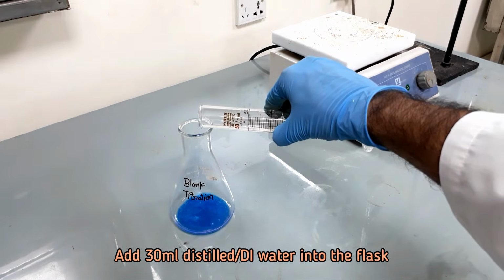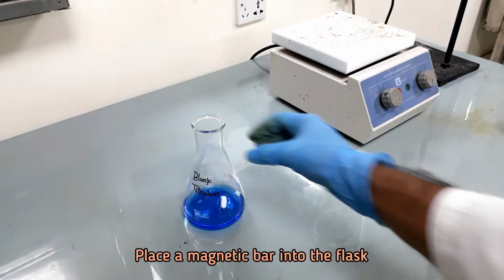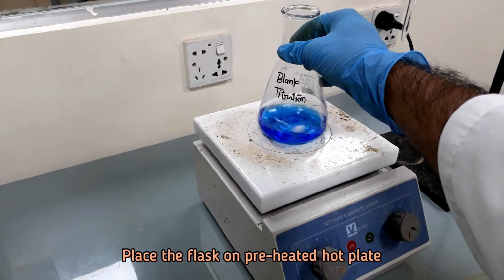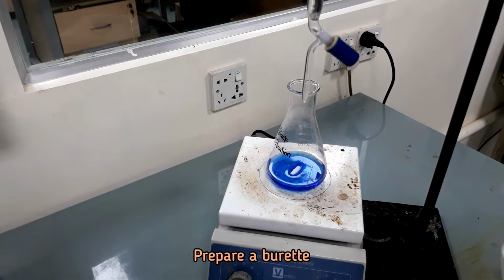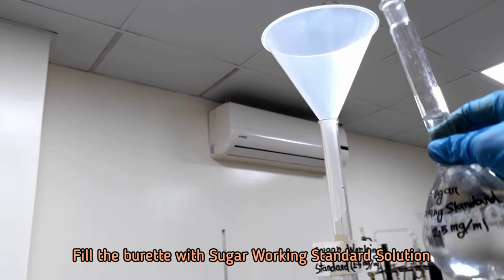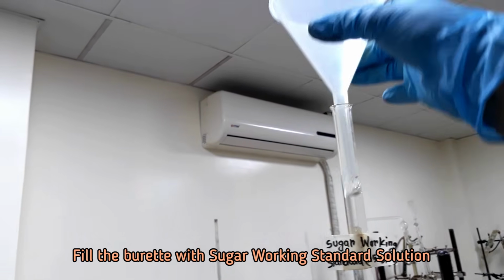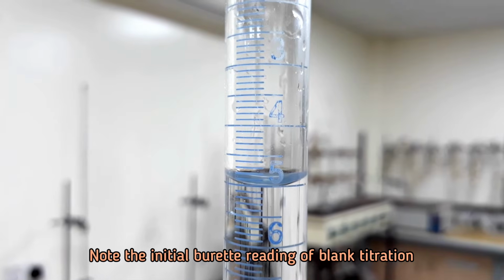Add 30 ml distilled water and a magnet bar. Place the flask on preheated hot plate. Prepare a burette and fill it with sugar working standard solution. Note the initial burette reading of this blank titration.